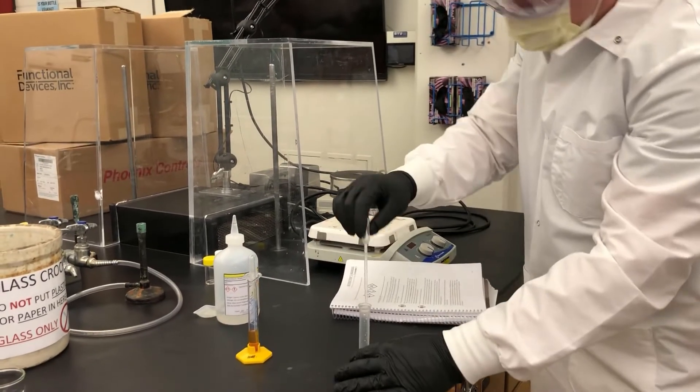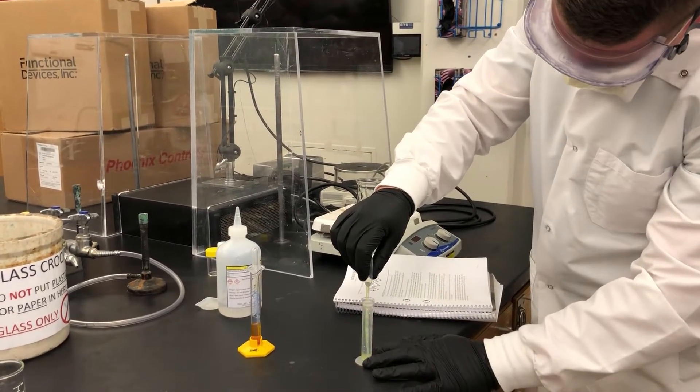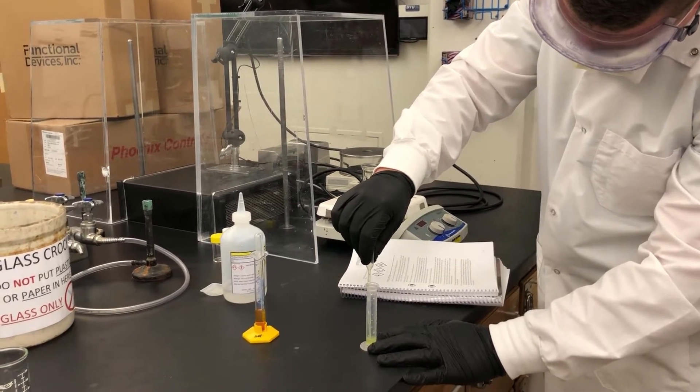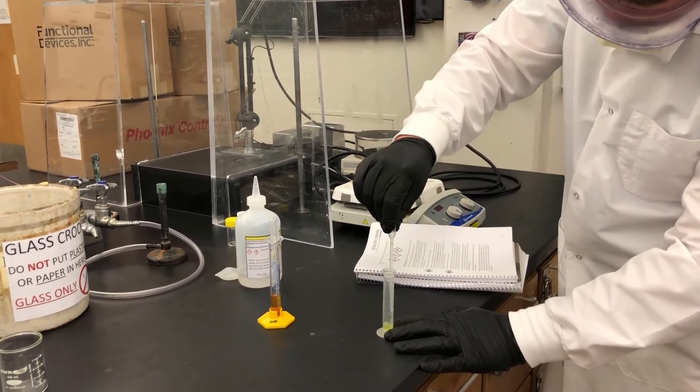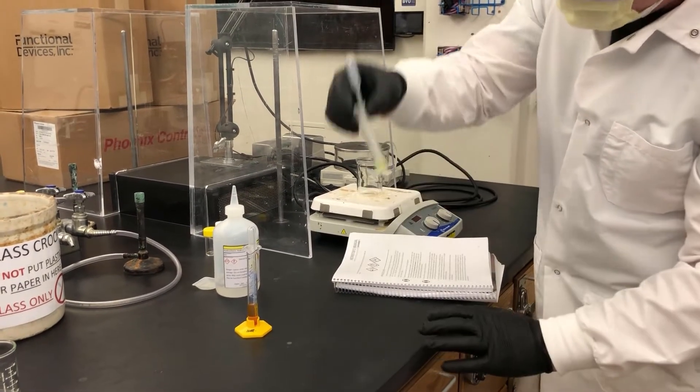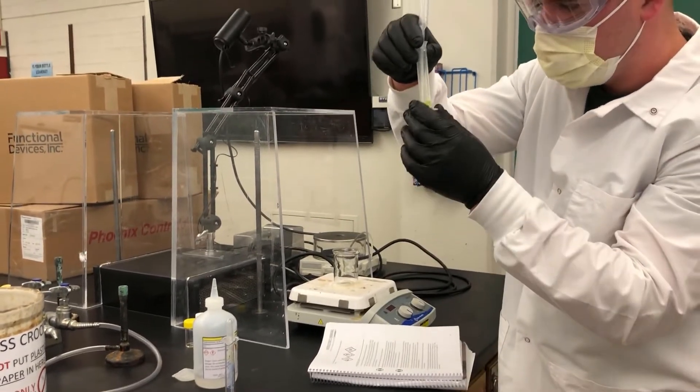Okay. I'll show it like there, I guess. It's not quite dissolved yet. Okay. Do you want to show them the solutions? Yeah.